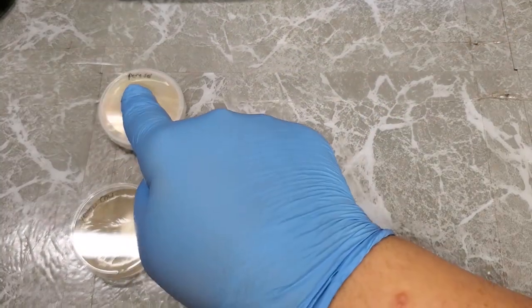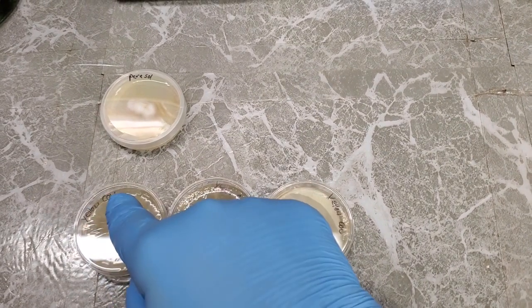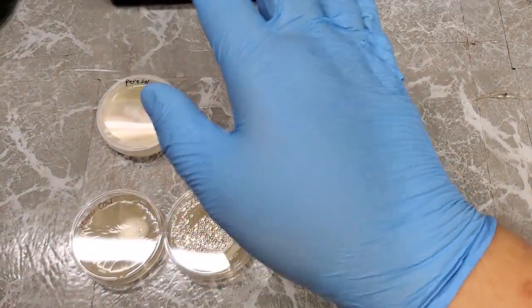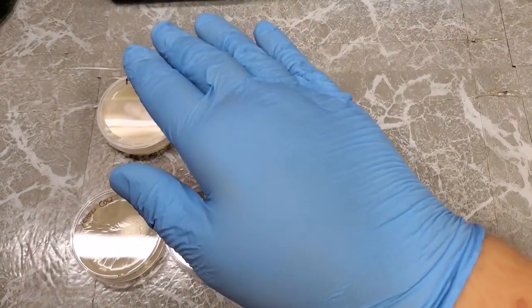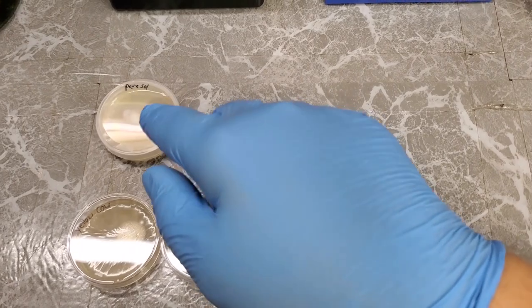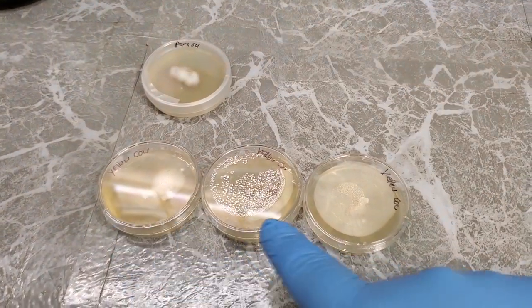You've probably noticed that up here, this petri dish does not say yellow pored chicken of the woods like these ones. This one up here says parasol. The reason why I have a completely different mushroom up here on one sole lonely petri dish is because I inoculated this at the same time that I inoculated these.